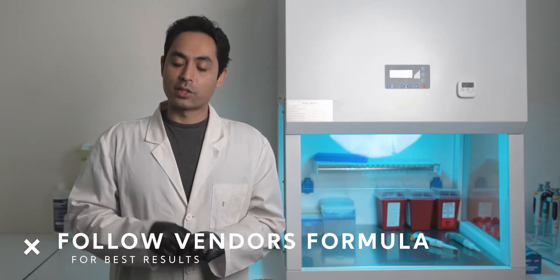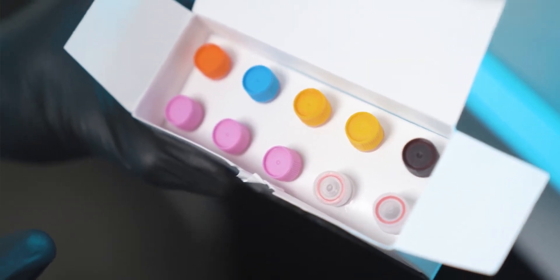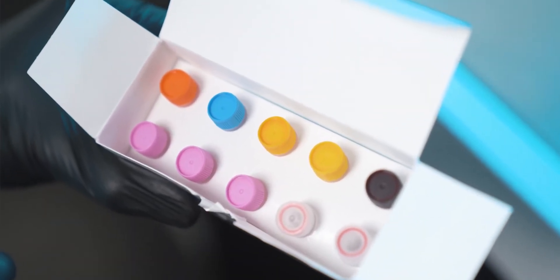Each vendor has a master mix formula you'll want to follow. This usually comes as a packaged insert. Each master mix has primer, probe, water, enzyme, and your DNTP buffer mix.